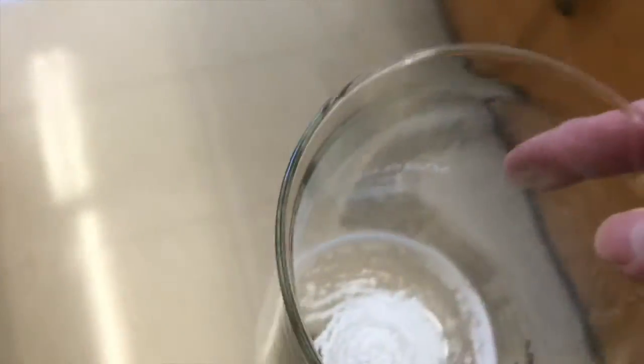crystallization. So I was thinking about this crystallization and I thought, what solvent should I use? I'm pretty sure ethanol is a good solvent for this, but I'm going to act as though I don't know that. I'm going to test a couple solvents for the crystallization. I'm going to test out ethanol and methanol and see which one looks most promising.